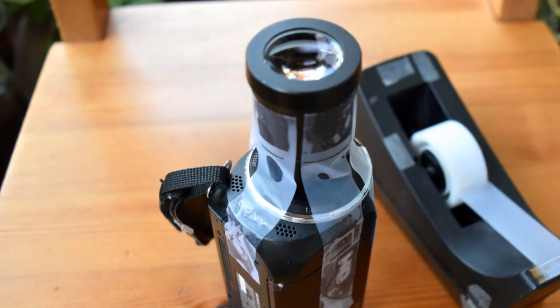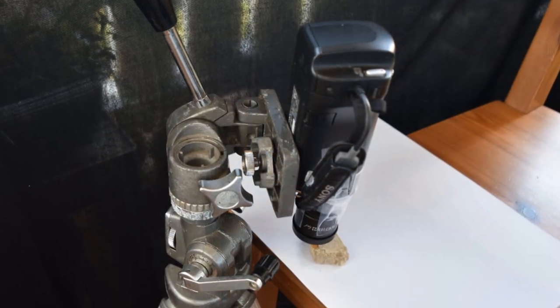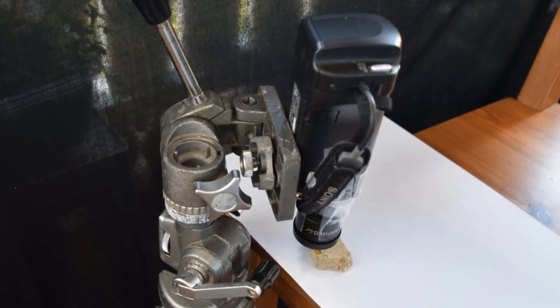It's not perfect, but it gives a glimpse to minute details and sometimes leads to small discoveries.